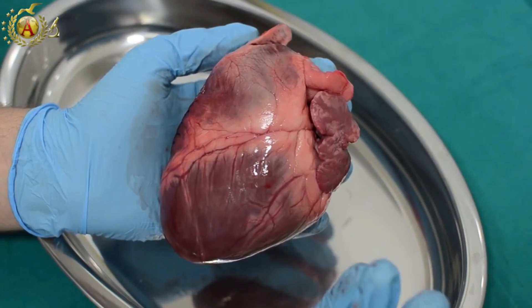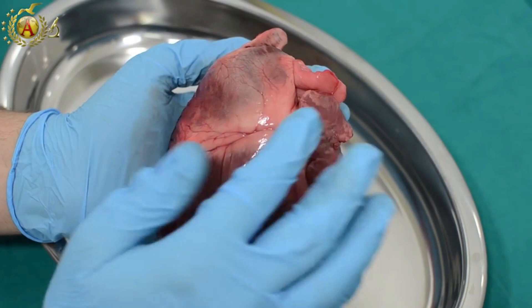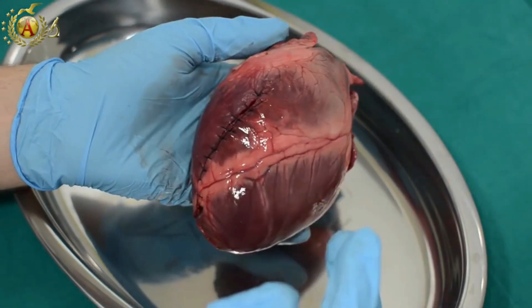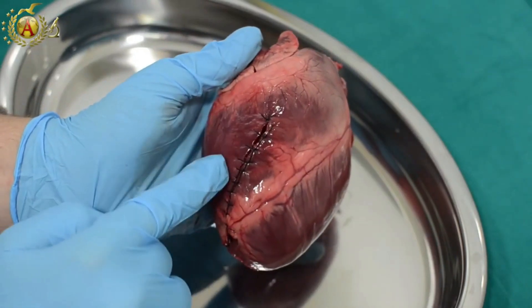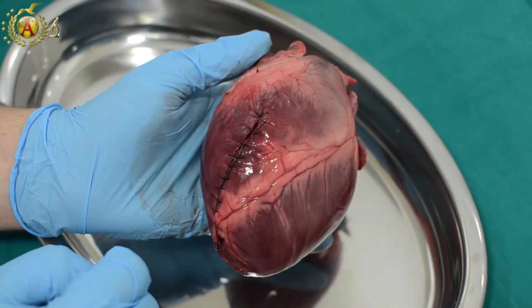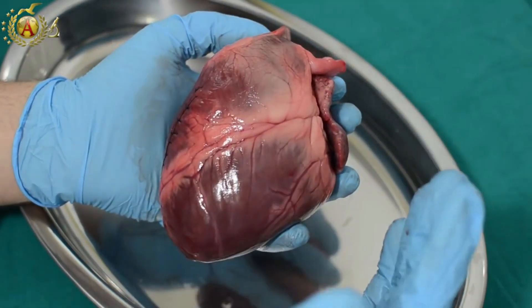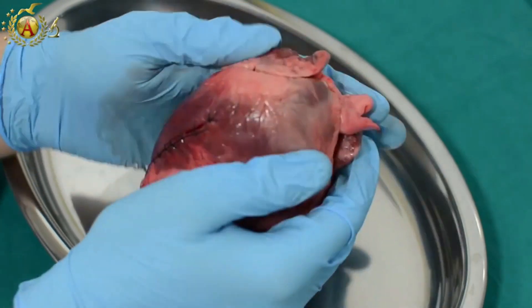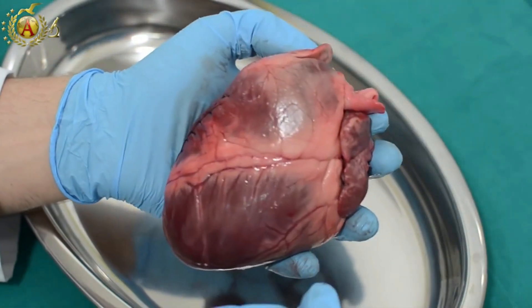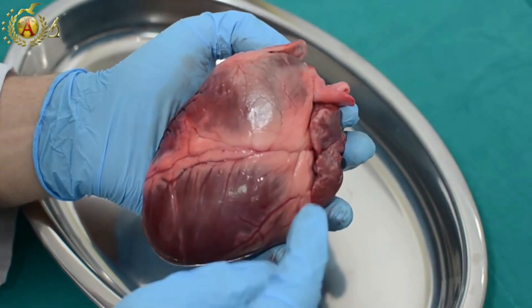The right part is easier to compress. The left, instead, is harder. This is due to the different muscular thickness of the two walls. This particular heart presents a large cut that was inflicted at the end of butchering in order to do sanitary controls on the animal. Another thing to observe about the external configuration is undoubtedly the sulci — they are furrows in which the branches of the coronaries run.